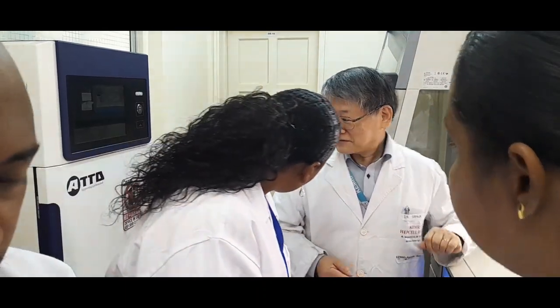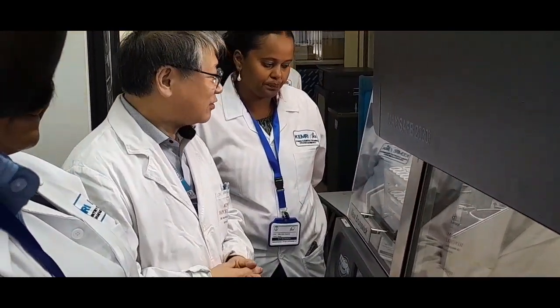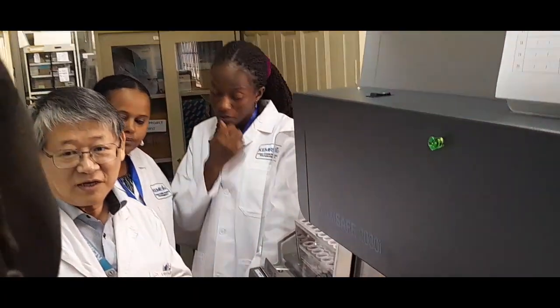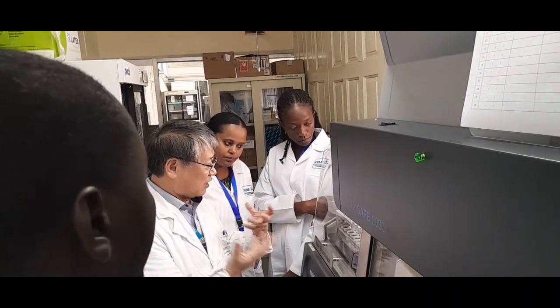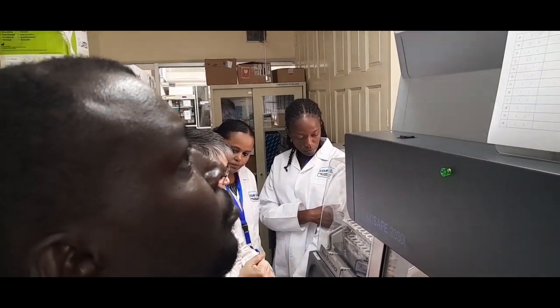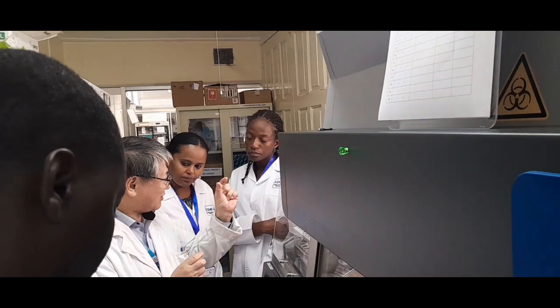Okay. Right? So this is mainly for recombinant DNA experiments. Using E. coli, we put in the protein expression plasmid, and by culturing the E. coli we can grow the number of bacteria, and then by adding IPTG, they will start to express the protein, which is derived from the virus.